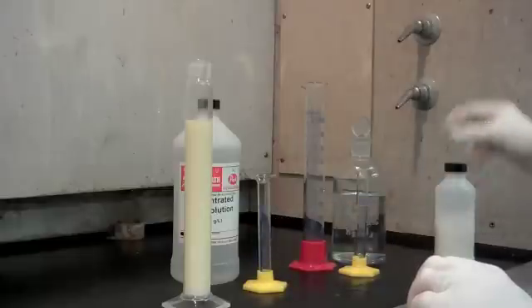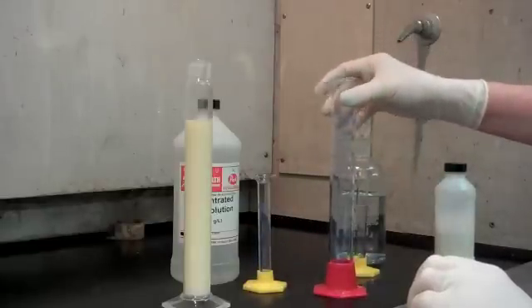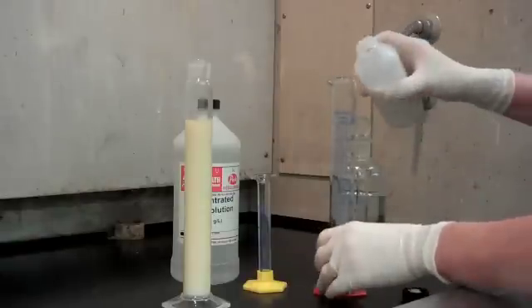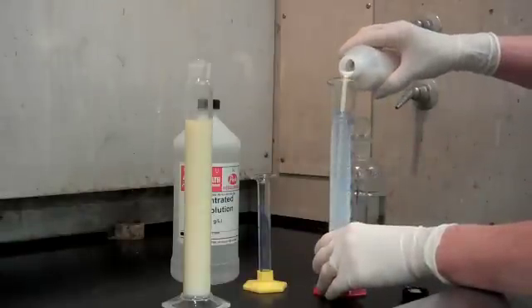The second way we can do this test, instead of salt, we would use sulfuric acid. Measure out 90 mL again.